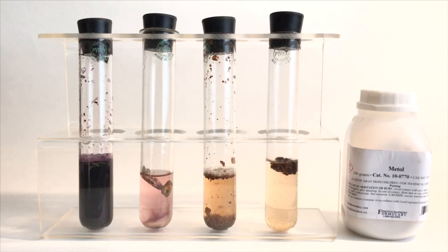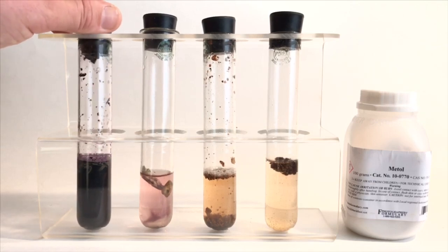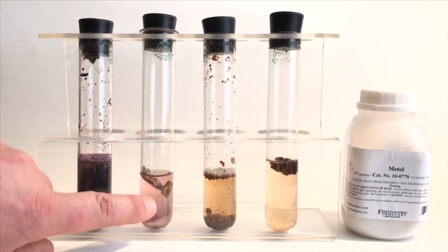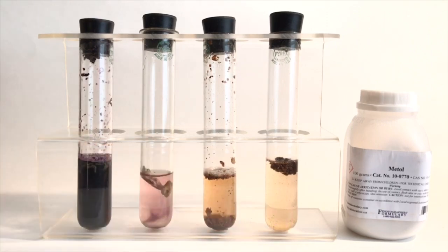So the only downside to the metol is that it's not something you can just pour down the drain. Pretty fascinating that this metol is a chemical that they use for exposing film. And I thought it was pretty fascinating how well this worked. It certainly worked really well here. And you can see that there's this purple color and you can see there's maybe like this brown color here. So just as the book described.